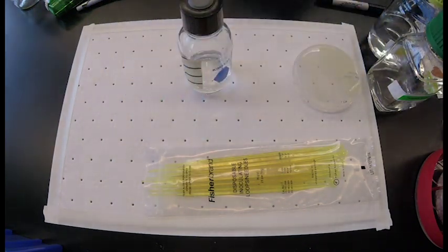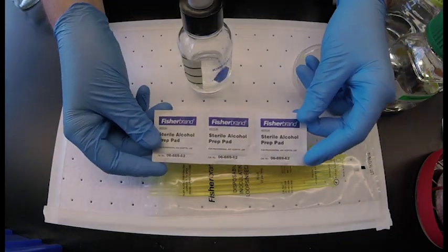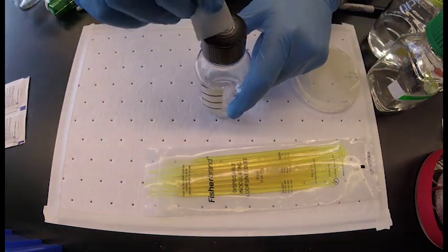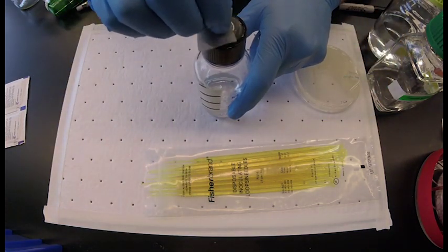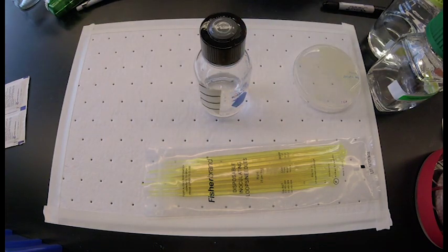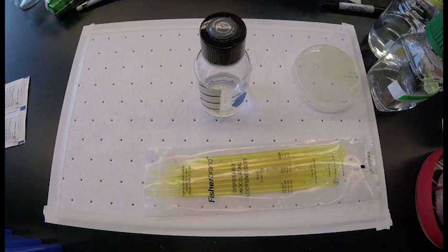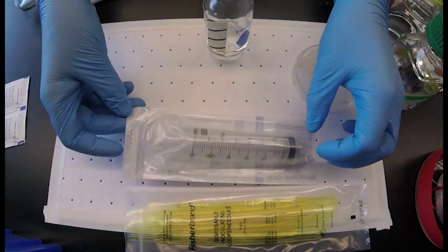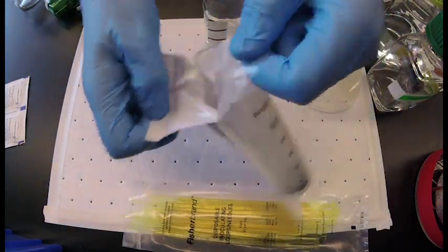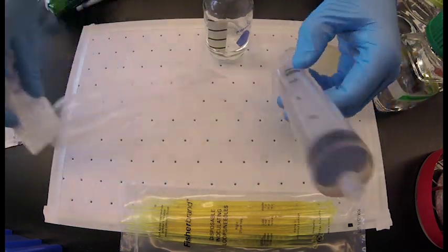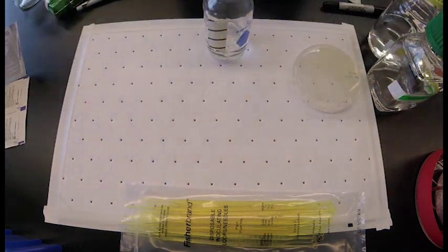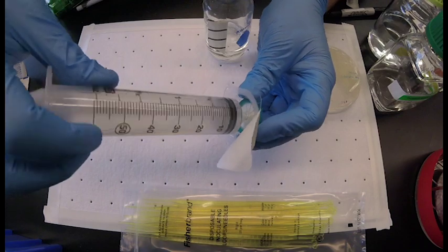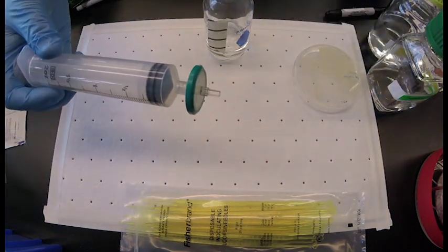To add methane to the bottle, first sterilize the septa with an alcohol prep pad. We add methane by filling a syringe and injecting it through a filter into the bottle. A filter is important to maintain sterility to be sure that only our methanotroph grows in the culture.